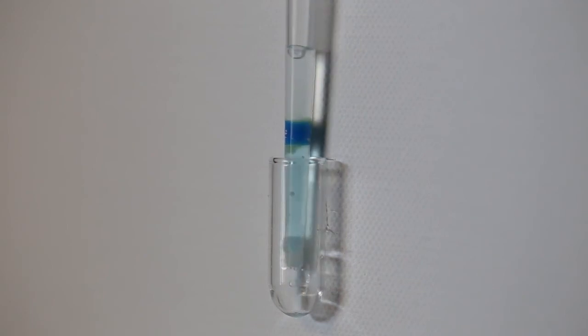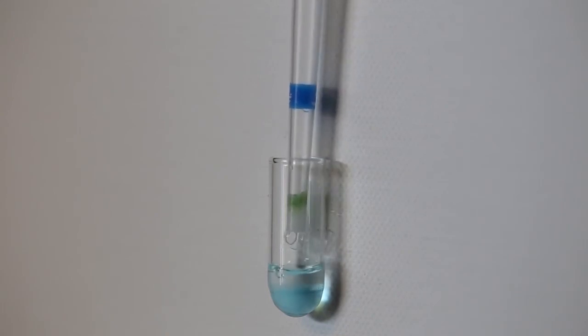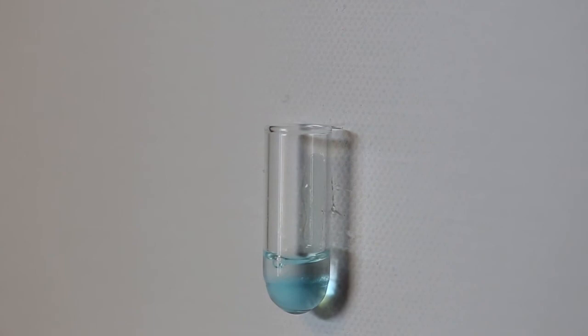Note the two layers formed inside the DPX tip where the sorbent settles on top of the bottom aqueous layer. The dispense solution contains two layers.